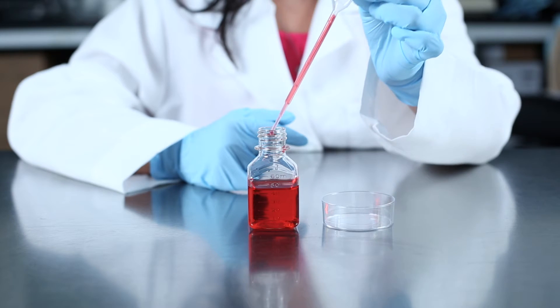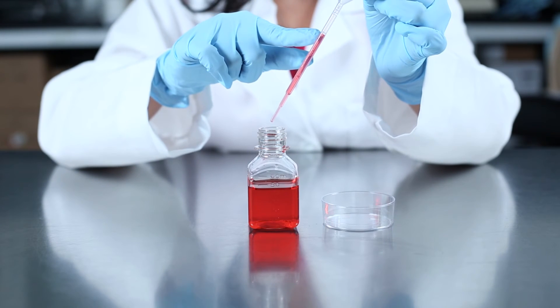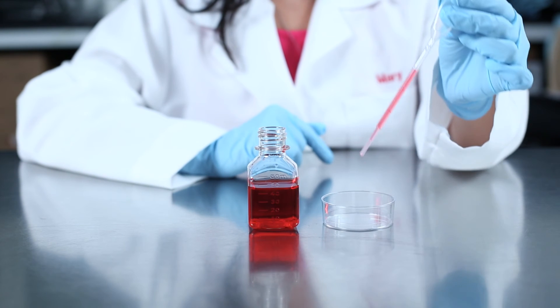Then, dispense the liquid to the graduated mark. You will notice that there is no meniscus with plastic. You can then dispense the required amount of liquid into the receiving container.